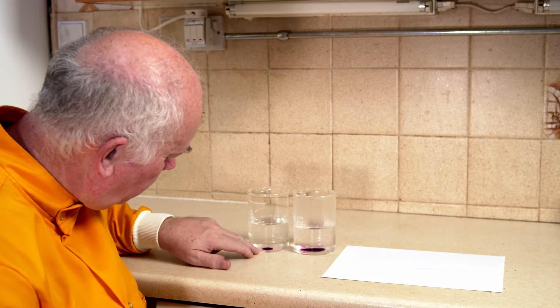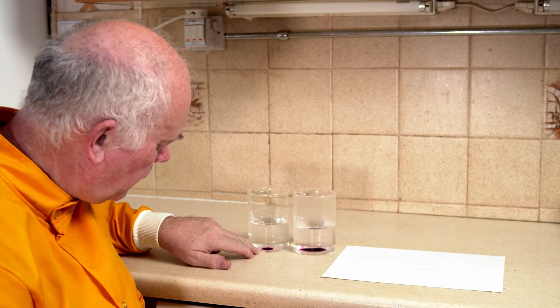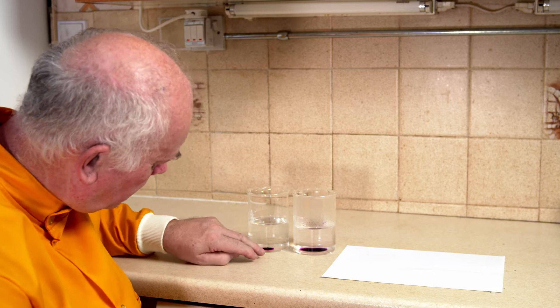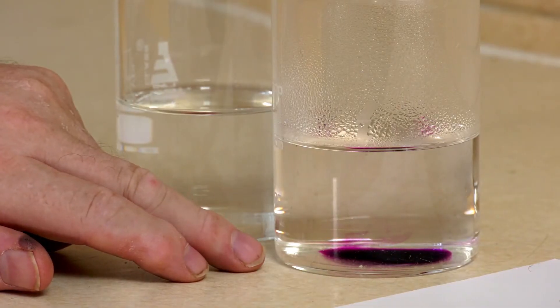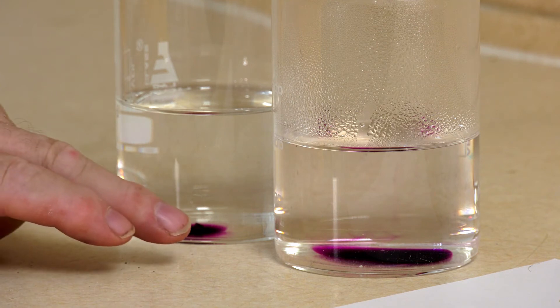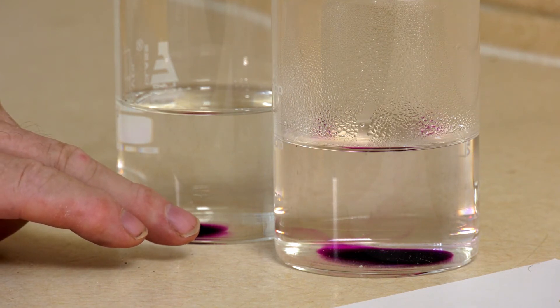The potassium permanganate is spreading out very quickly, and in the cold water it is spreading out but very much slower. We can see two rings — in fact, a complete gradient from very light to very dark. And already this one has occupied nearly half the area at the bottom, and in a minute we should probably see it start to go uphill. And there it goes.